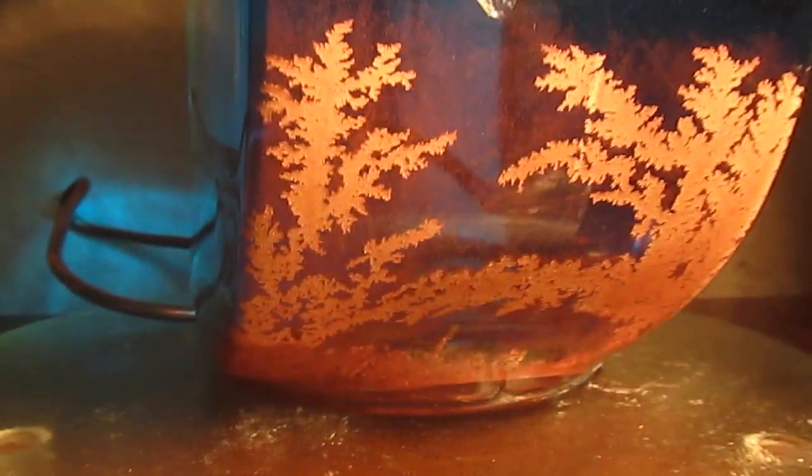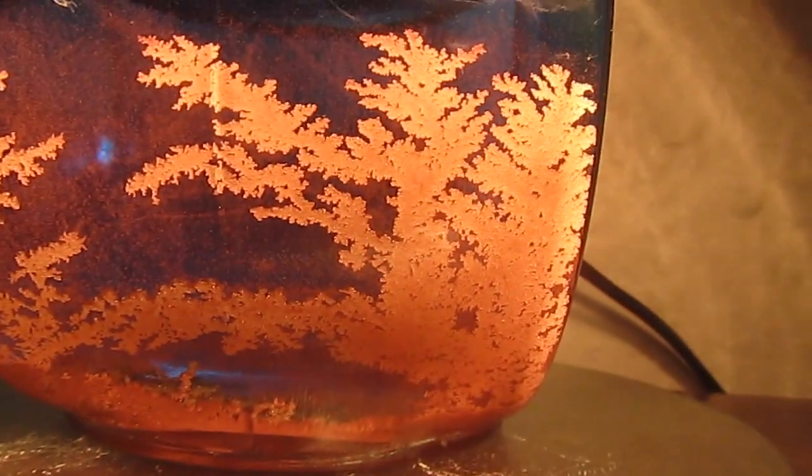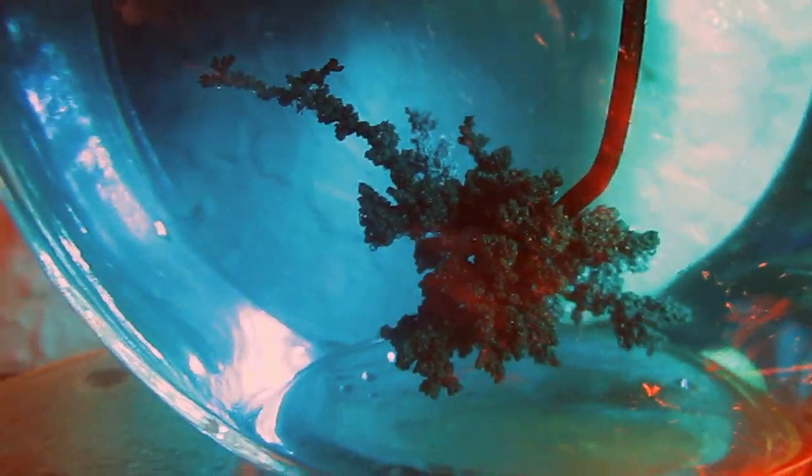This was giving nice results, but it was interesting to see that the copper dendrites were growing up the side of the container.